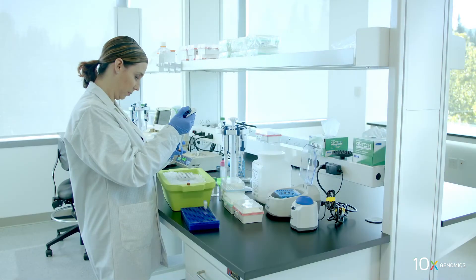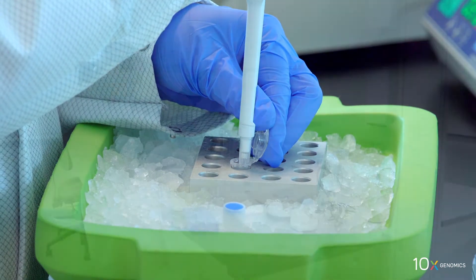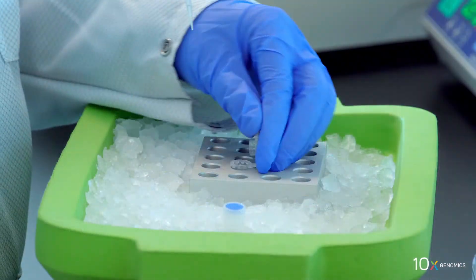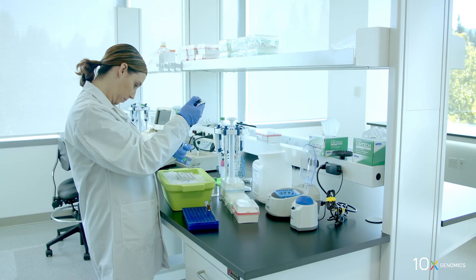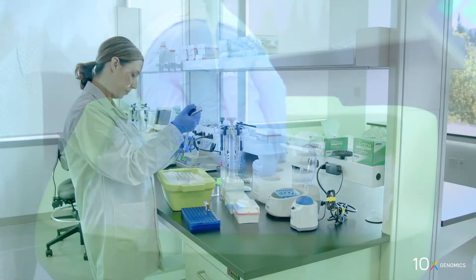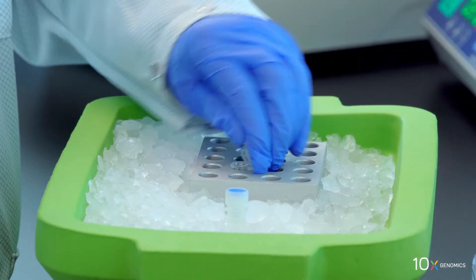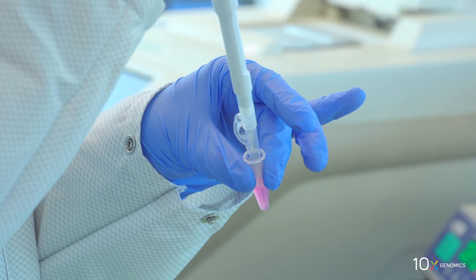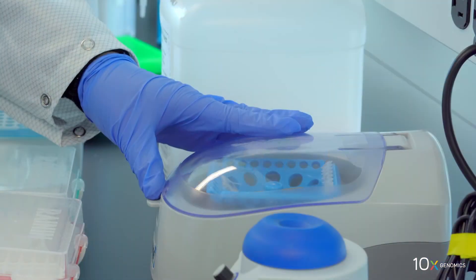Then RT Reagent C. Then template switch oligo. Then reducing agent B. And finally, RT Enzyme D. Pipette mix 10 times with the pipette set to 400 microliters and spin down briefly.